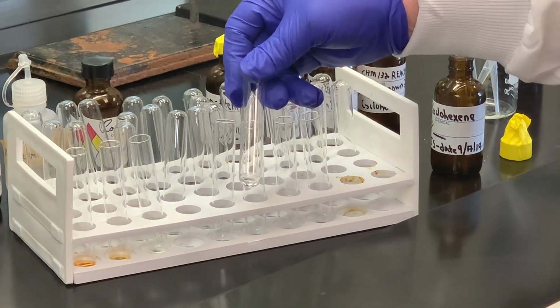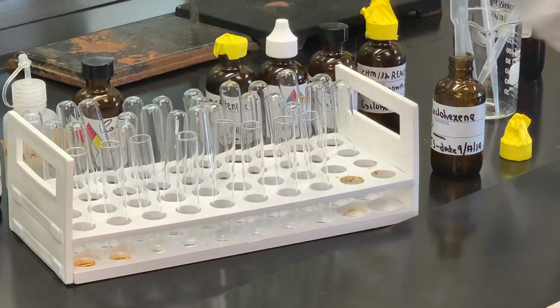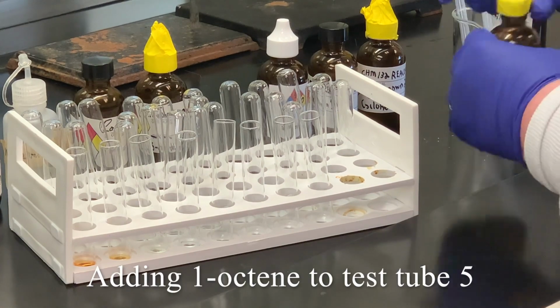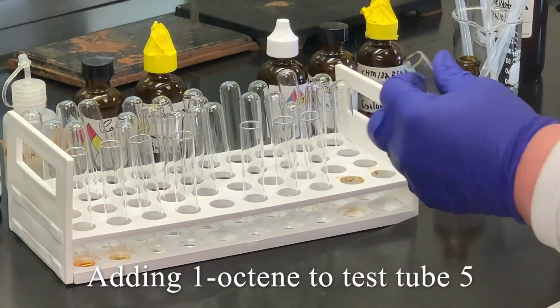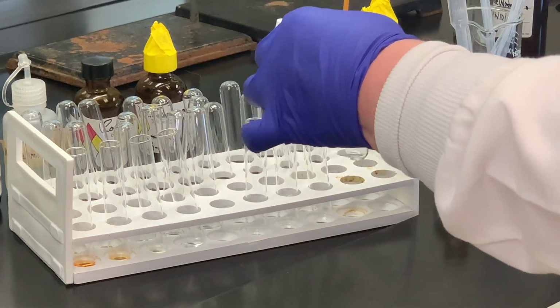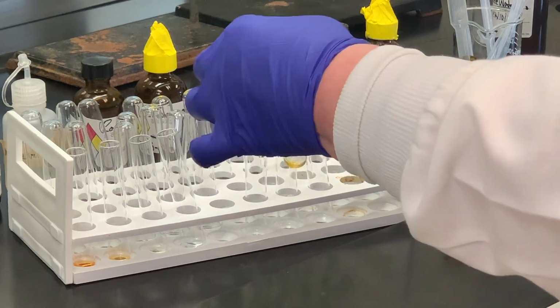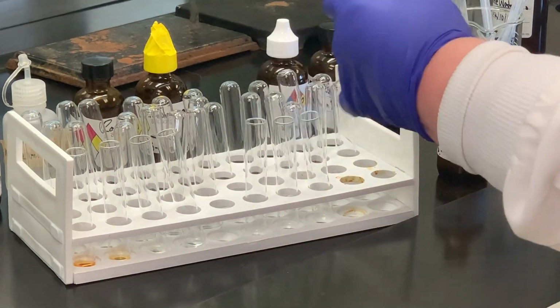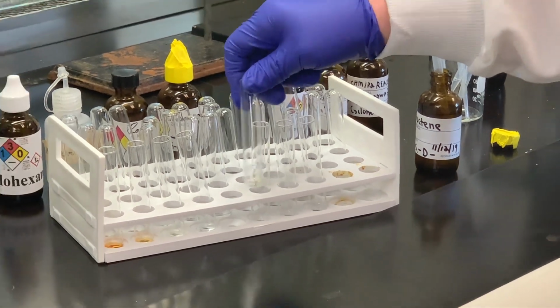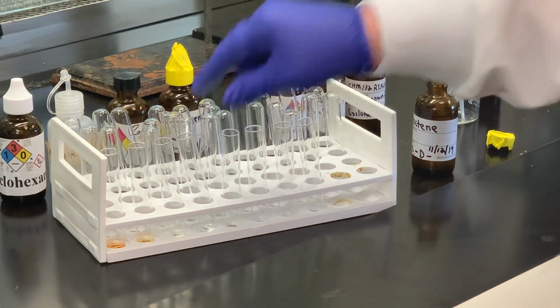And you can tell that the color disappeared, meaning we've got that carbon-carbon double bond. Next compound is 1-octene. Add some of the bromine solution. And you can tell that the orange color disappeared there.